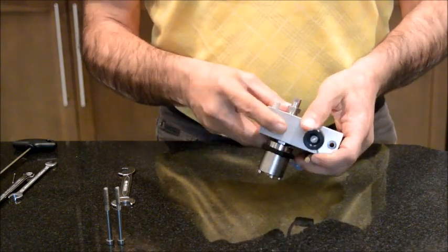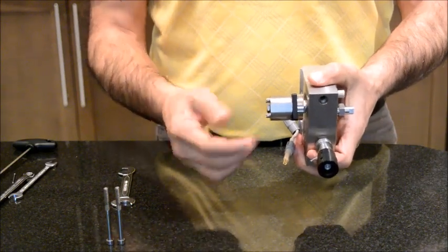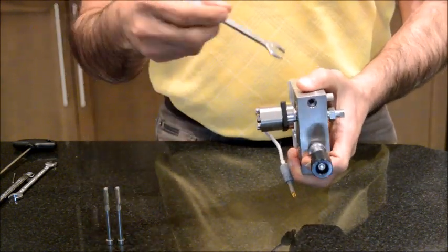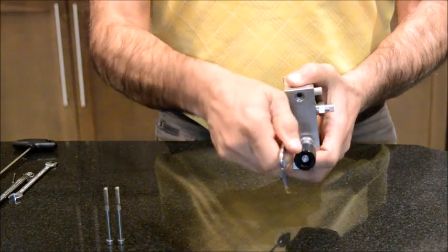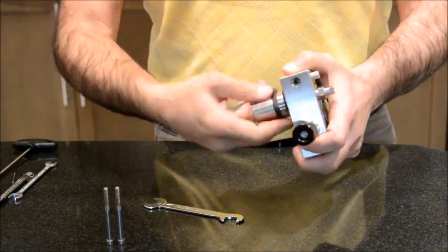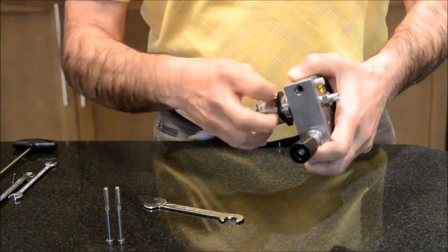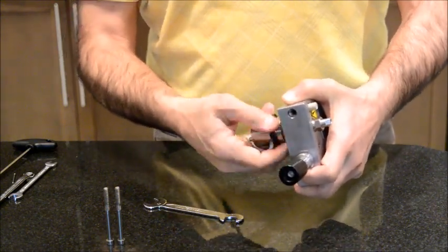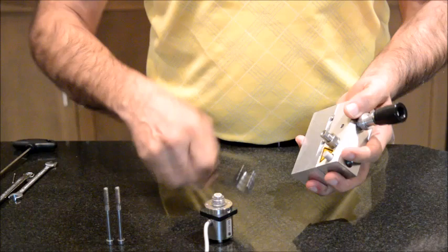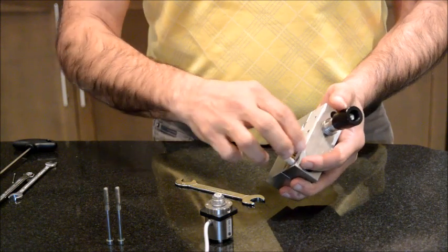So before I continue any further, let me start opening these up and we'll see which parts I'm talking about. First of all, I have made them loose already, so when you're going to remove these parts in your system, it will be much harder. Because if it's this loose, then you're going to have a leak. Anyway, I will open up the inlet valve first, and I will remove the outlet valve next. Again, I have already loosened them up.